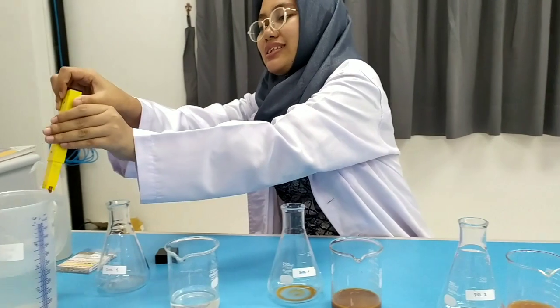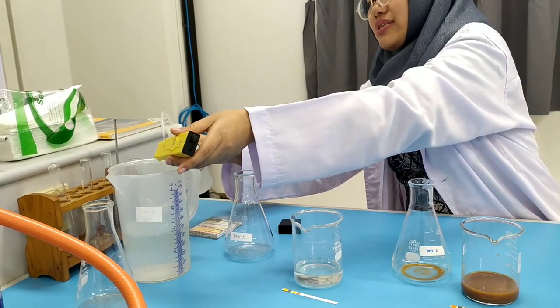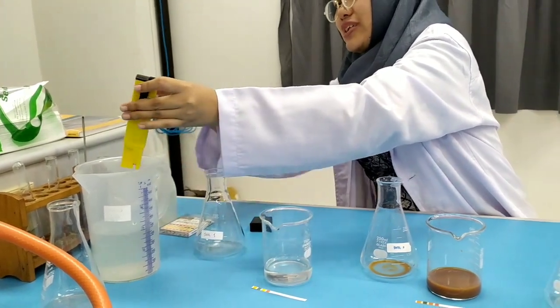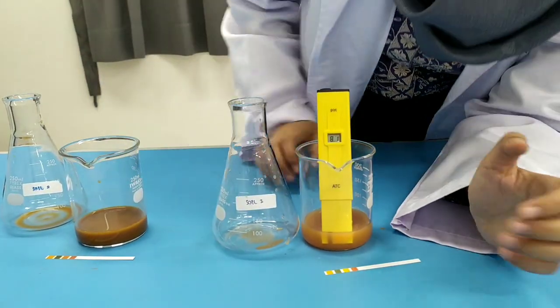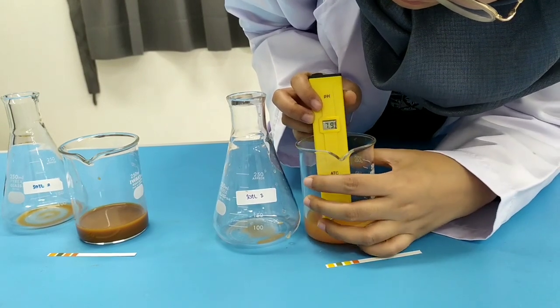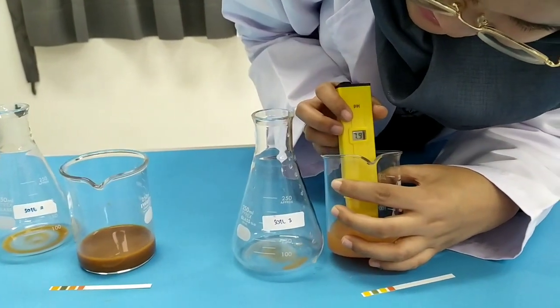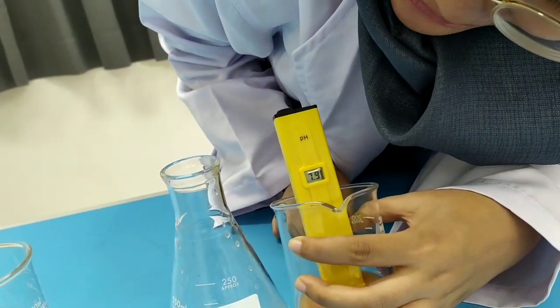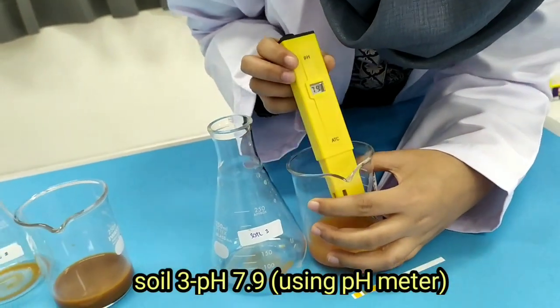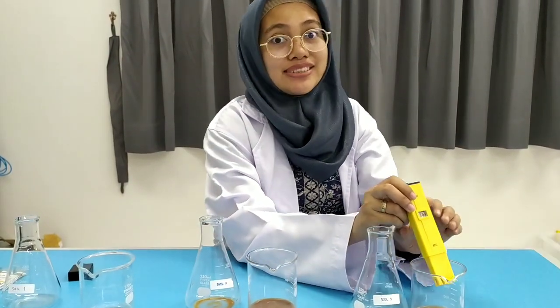Let's rinse the meter with distilled water again — it's neutral. Now let's dip it into the third soil. It's showing 7.9, and I think it's stopped. So we already got the result for soil three: pH 7.9. We are done with all pH measurements using both the pH meter and the pH paper.